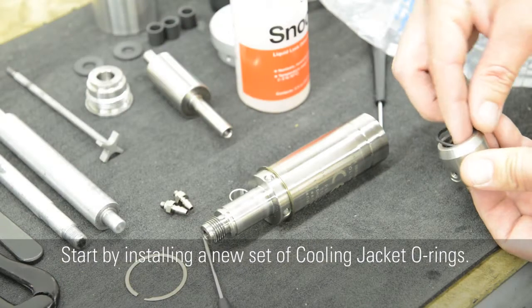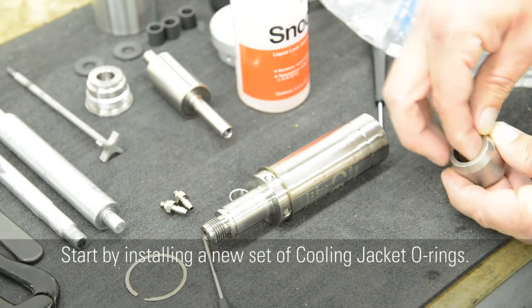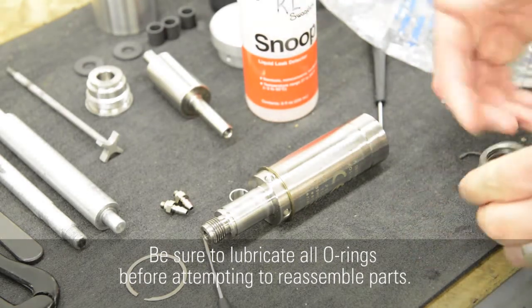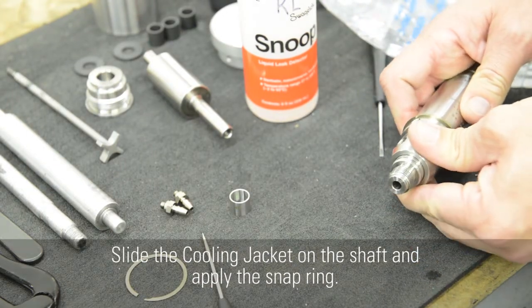It is at this point that all consumables have been removed from the mag drive and reassembly can now take place. It is also recommended to thoroughly clean all surfaces, both inside and out, before reassembly. Start by installing a new set of cooling jacket O-rings. Be sure to lubricate all O-rings before attempting to reassemble parts. Slide the cooling jacket on the shaft and apply the snap ring.